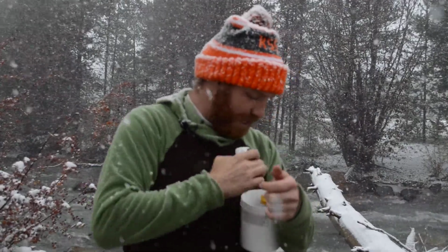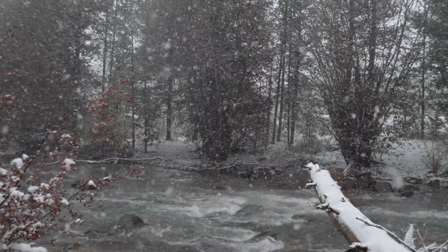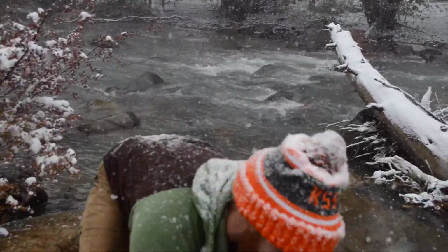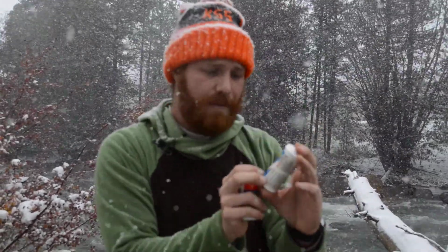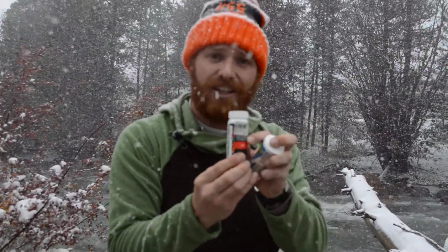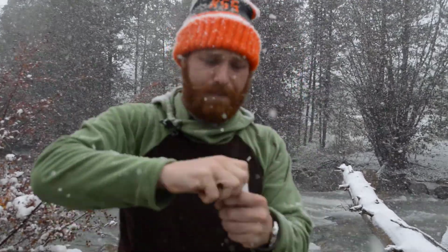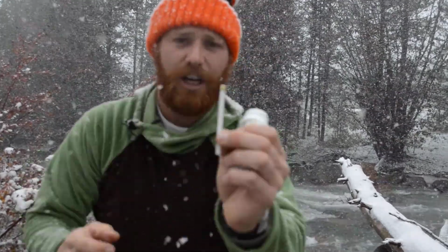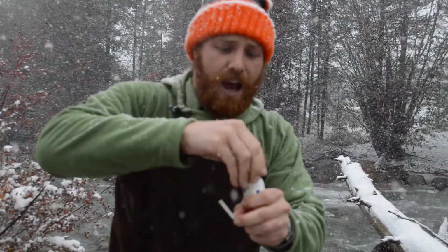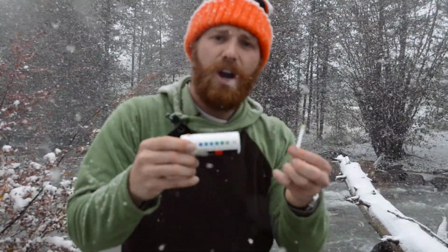Now, lastly, we have different tubes that have test strips in them. I'm going to pull one more out to show you guys. Right here is a copper test, all right? And this one is pH. So I'm going to do a little demonstration to show you how these pH test strips work. Now you open up the container and you pull out one of these little strips. Looks just like this.